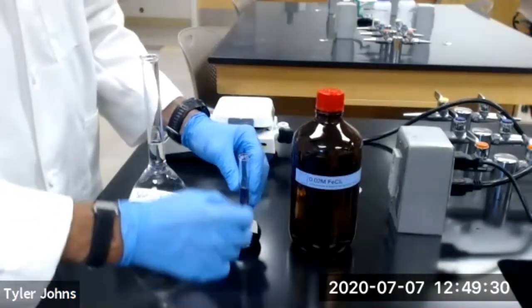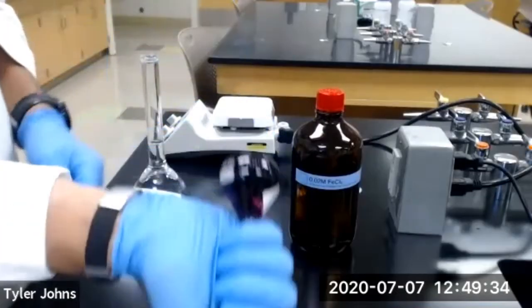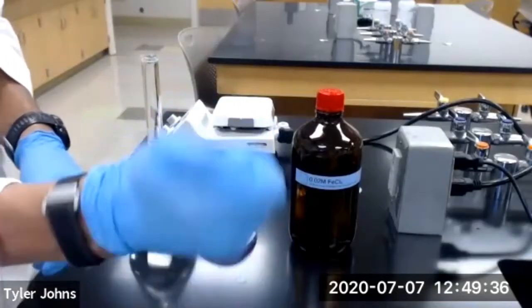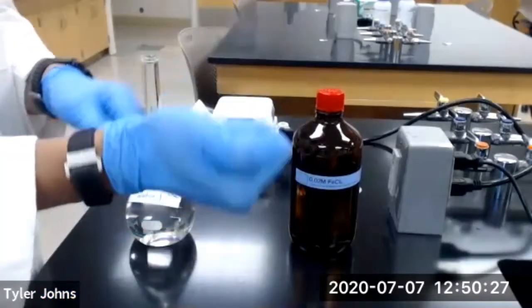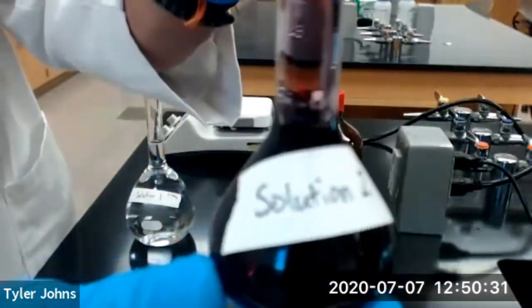We're then going to stopper our flask and invert to mix at least 10 times. Your solution 2 should have a purple color.